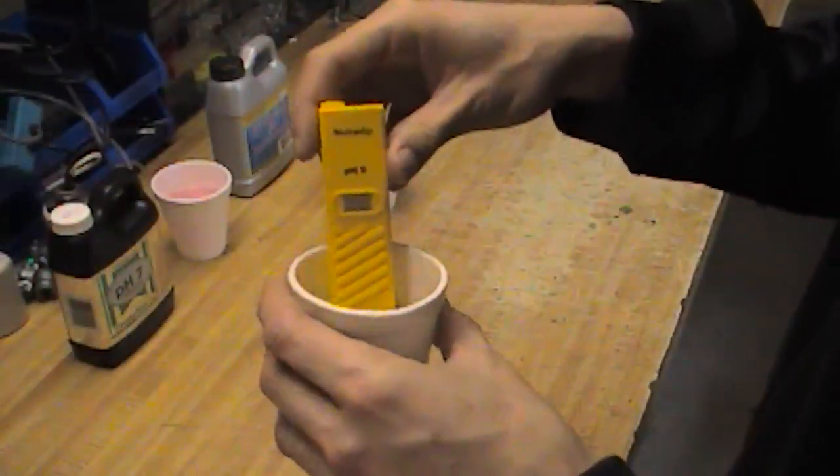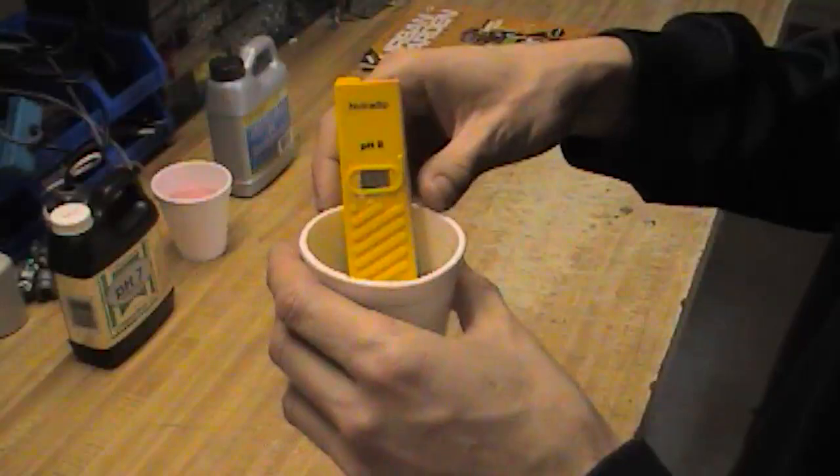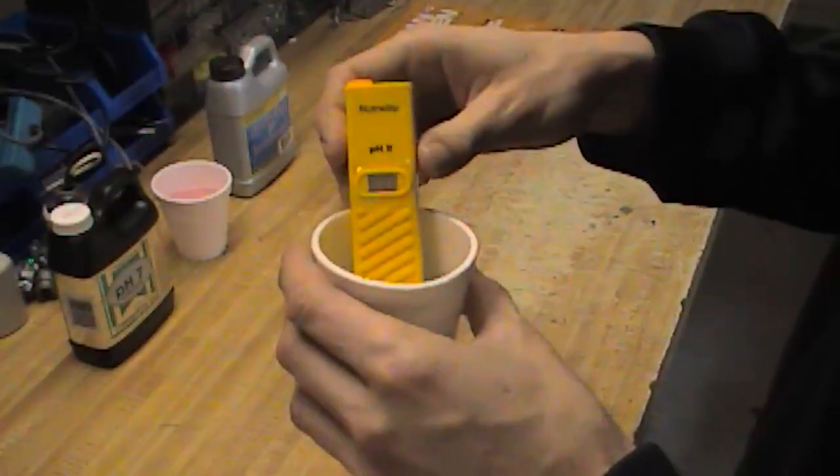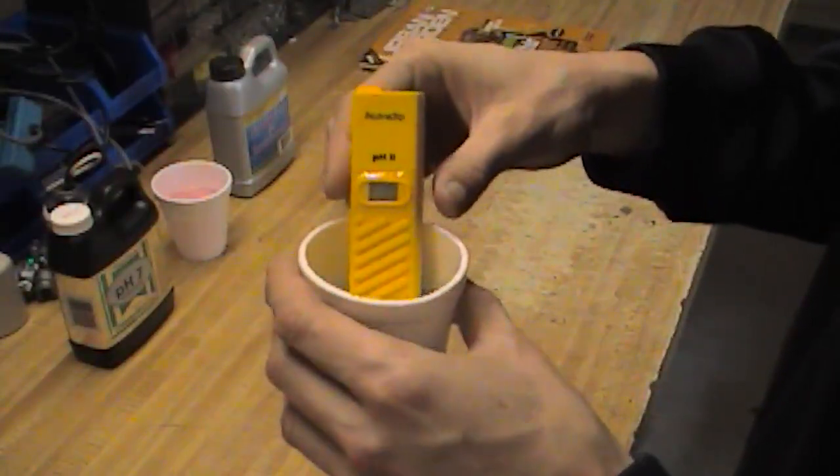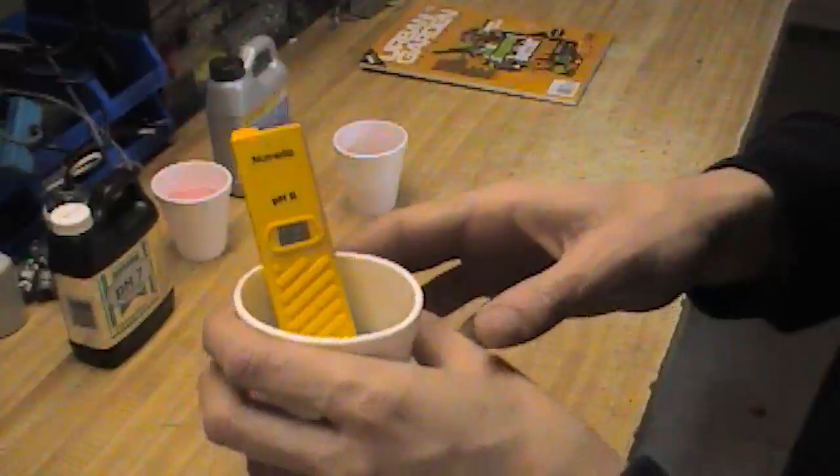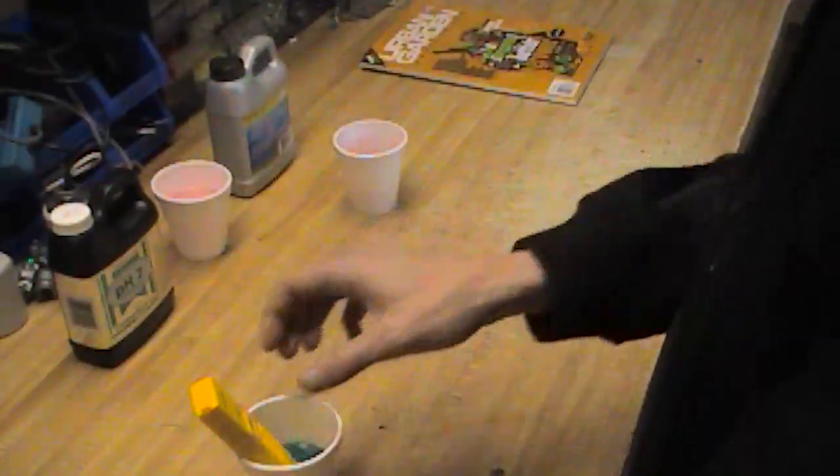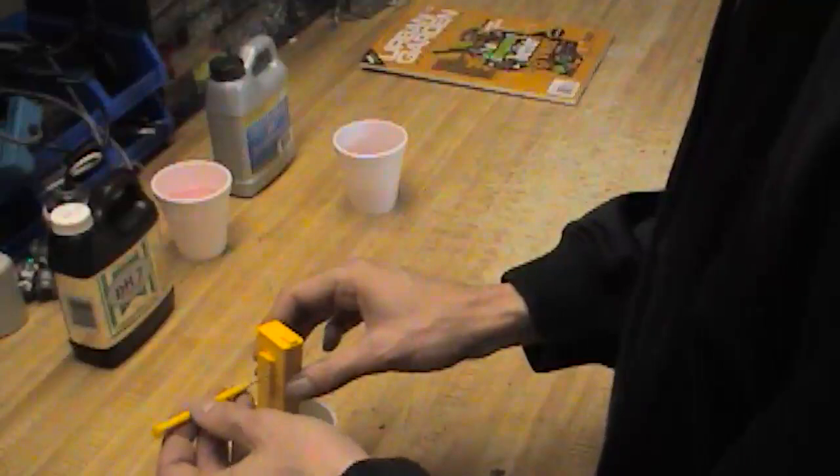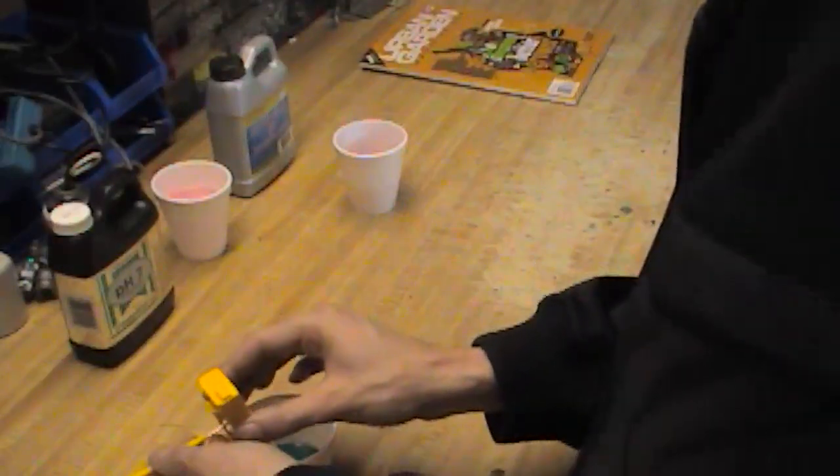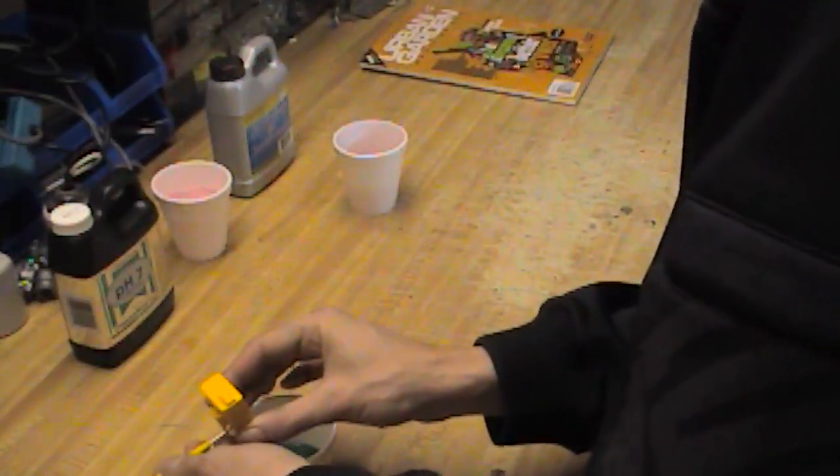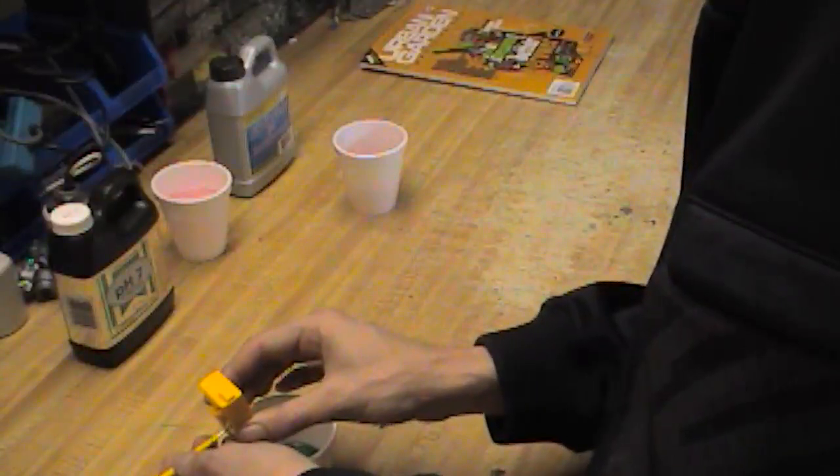Now that it's reading 7.1. Now I'm a very anal perfectionist here, so I'm going to zero this into 7. Sometimes you do have to go back and forth depending on how far it's out.